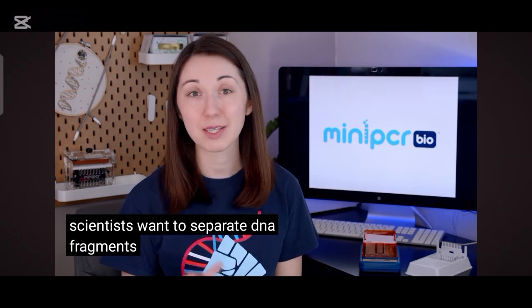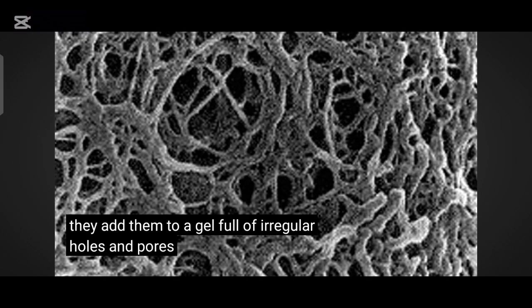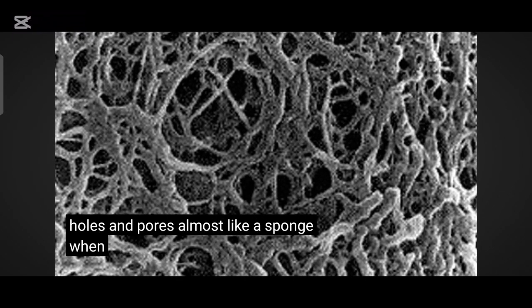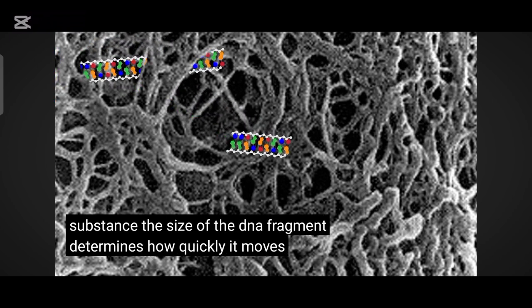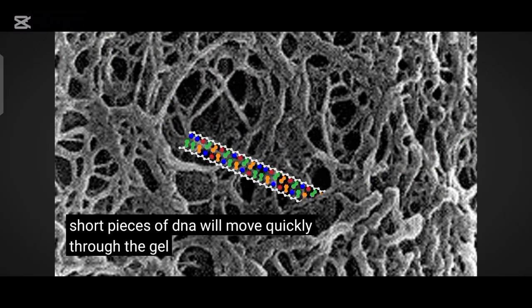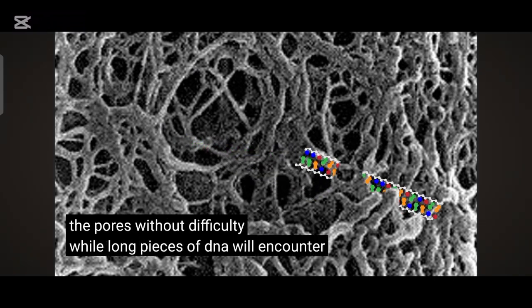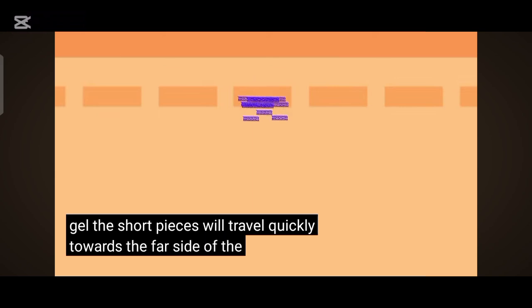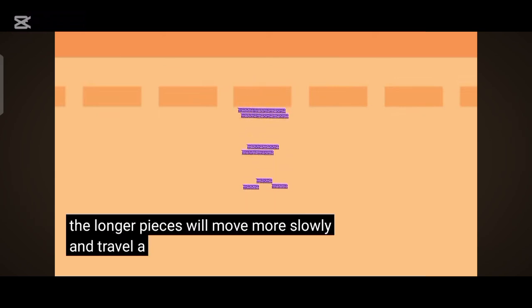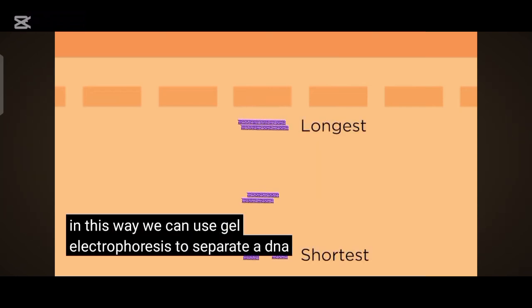With no obstacles, all fragments of DNA would move at the same speed towards the positive electrode. But scientists want to separate DNA fragments by size, so in gel electrophoresis they add them to a gel full of irregular holes and pores, almost like a sponge. The size of the DNA fragment determines how quickly it moves. Short pieces of DNA will move quickly through the gel, zipping through all of the pores without difficulty, while long pieces will encounter more hurdles and move more slowly. In this way, we can use gel electrophoresis to separate a DNA sample based on size.